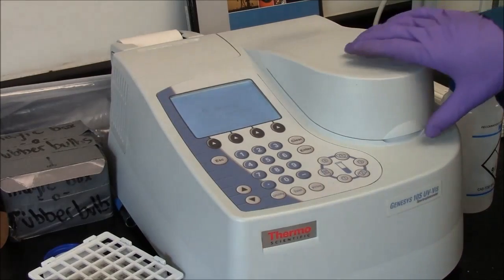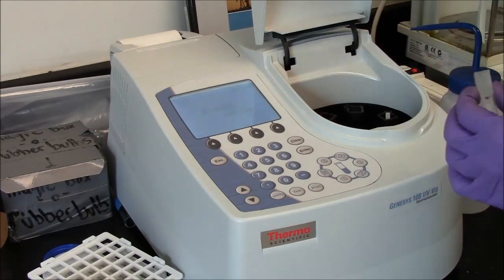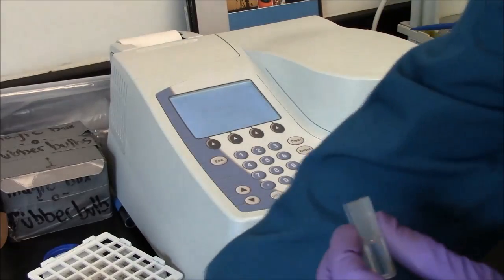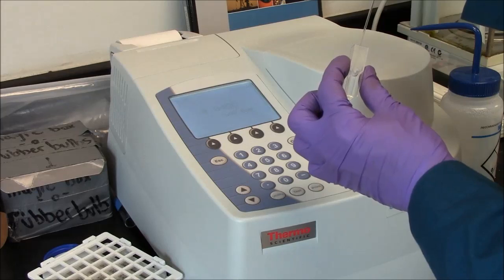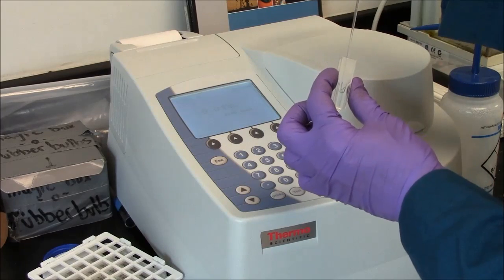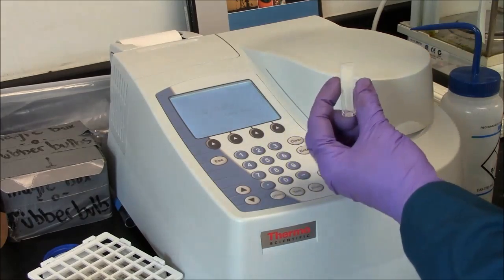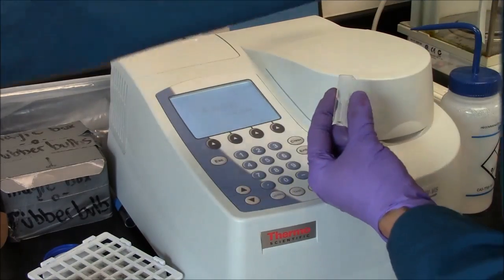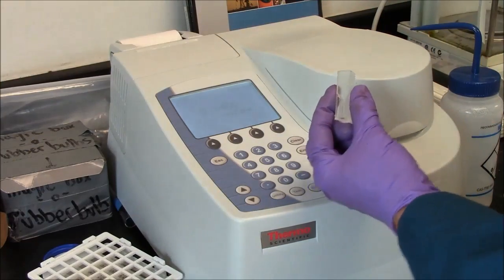To measure my sample, I will remove the blank and use a pasteur pipette to remove the contents. So with skill, I can pipette out 99% of the fluid in the cuvette. That was well done. That's water, it's just going in a waste vessel.